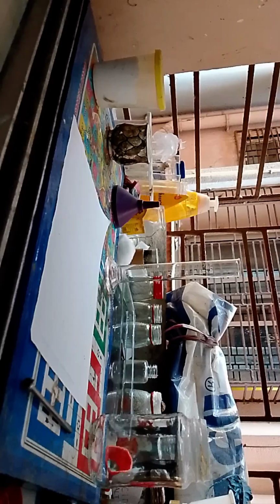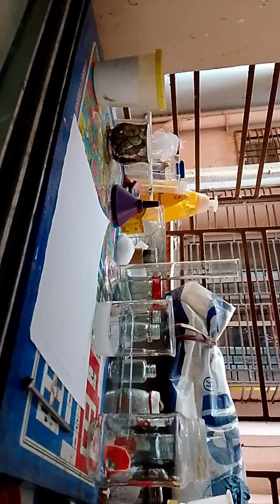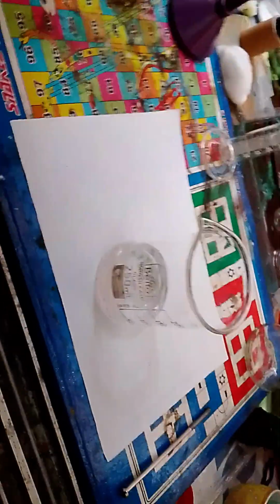Now it's going to make a cloudy solution as usual from my first video, but it's fine. Okay, now we need to wait for it to dissolve. Now what I'm observing is that this solution is clear. Okay, and it is the sodium carbonate solution, a roughly 10% solution of sodium carbonate.